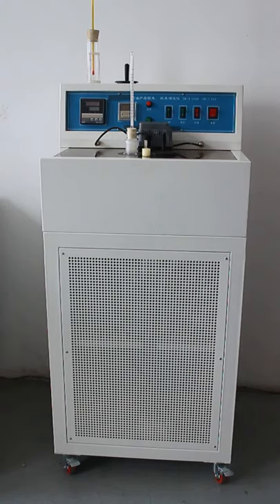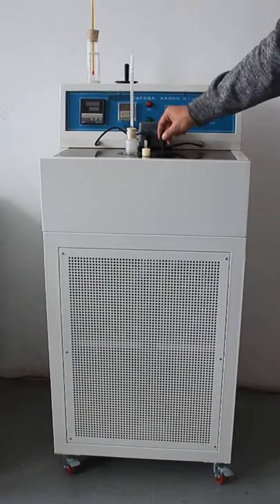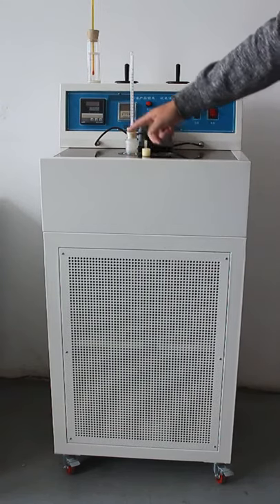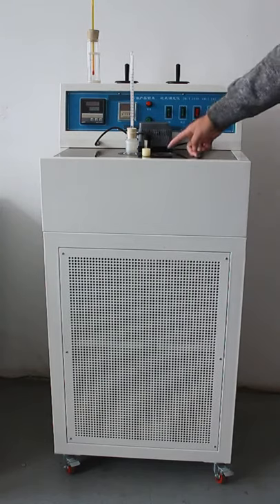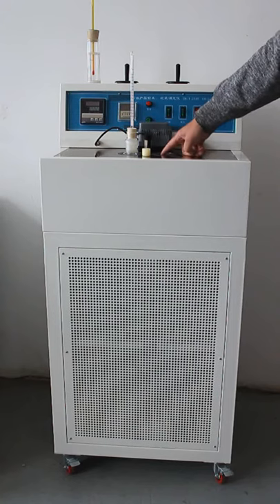On the test area there are two sample holes. Remove the cover — you can see this is one hole and another one. This uses the same box for cooling. Add 95% ethanol into the cooling box through the sample hole.